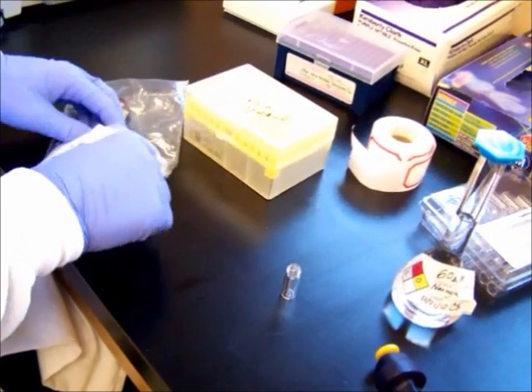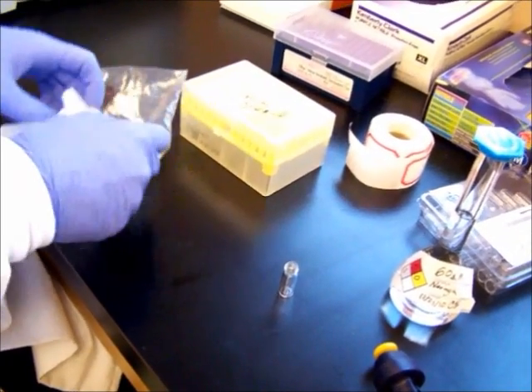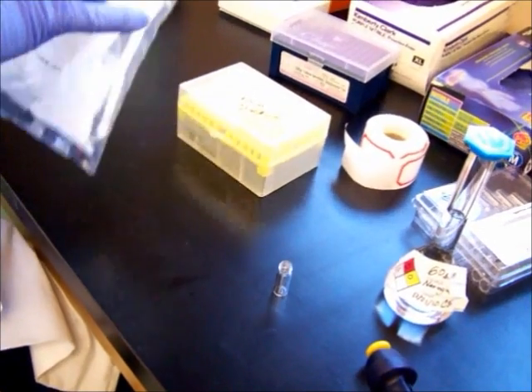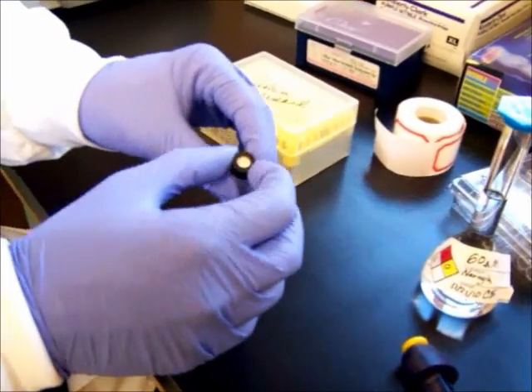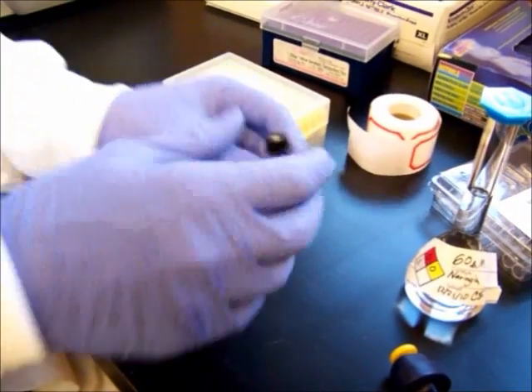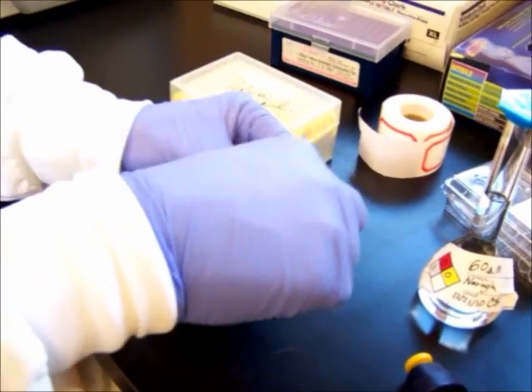Pause while he gets out the cap. There's the cap. The cap has a special membrane on top of it. When you load this in the autosampler, a needle comes down, punctures the cap, takes a little material out, and then retracts.